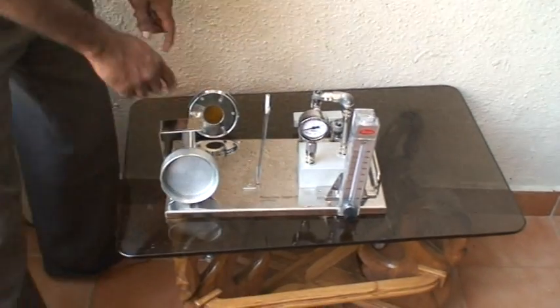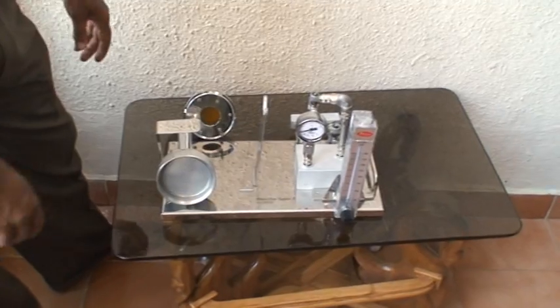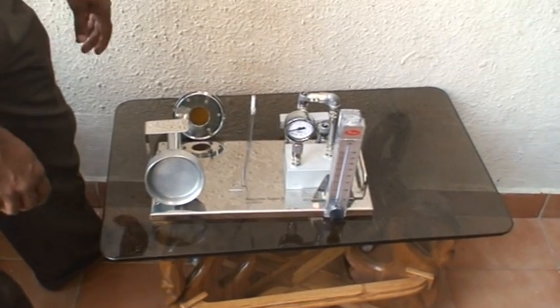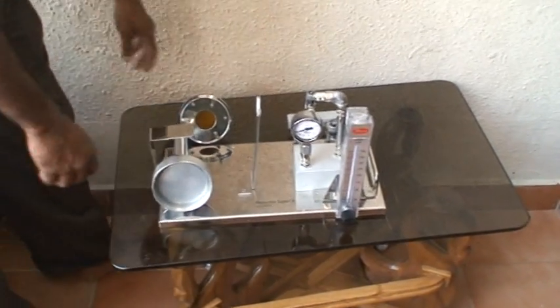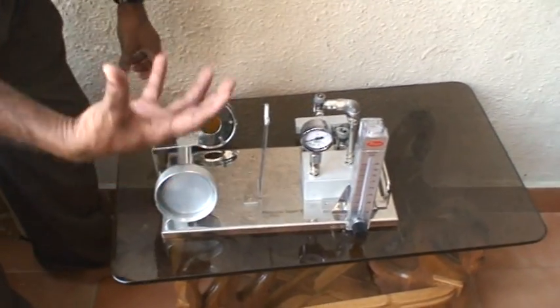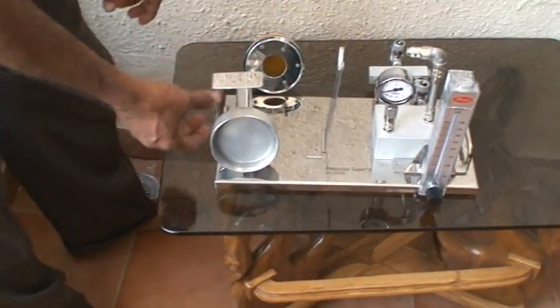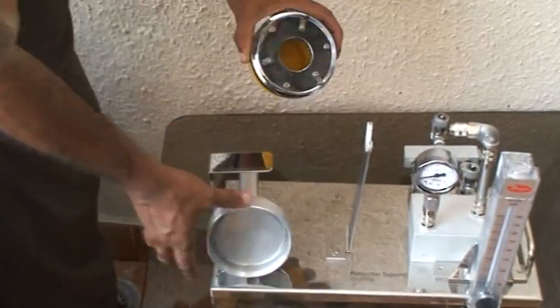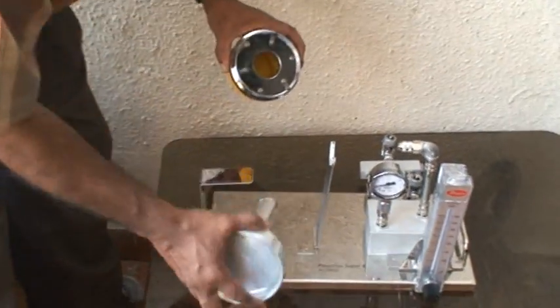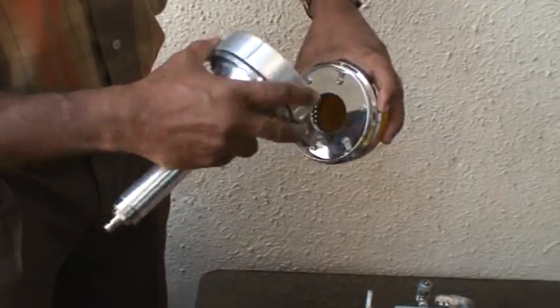This is the Pinocchio system, which is used for air sampling from compressed air. The petri dish containing the agar plate is placed into this unit and then assembled. This system is totally auto-clavable.